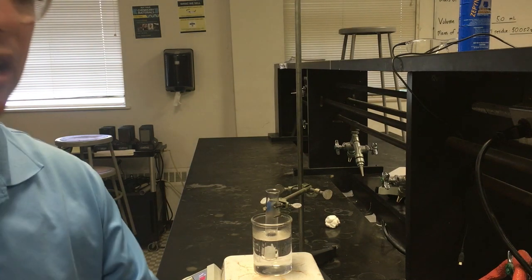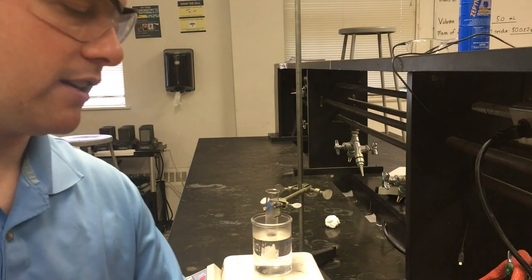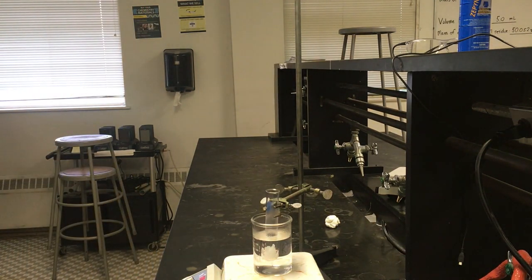I've taken my thermocouple here, I still have it. I've gone ahead and cleaned it off so that we can use it for this last trial again. I'm going to give this just a couple minutes for everything to melt. And then we'll go ahead and add our thermocouple, remove everything, and watch this one the same way we did the first 2 trials.